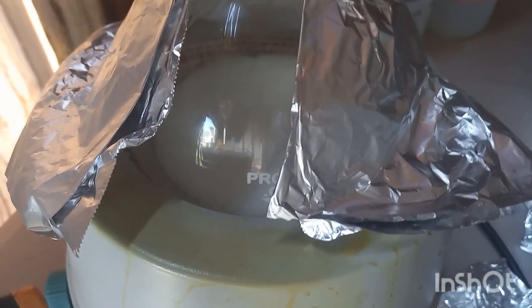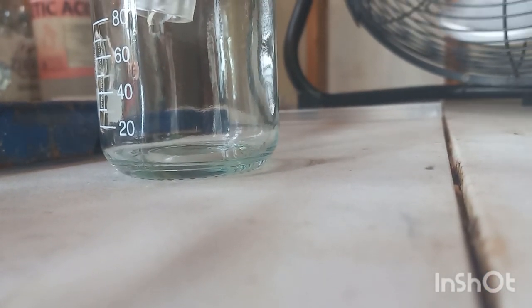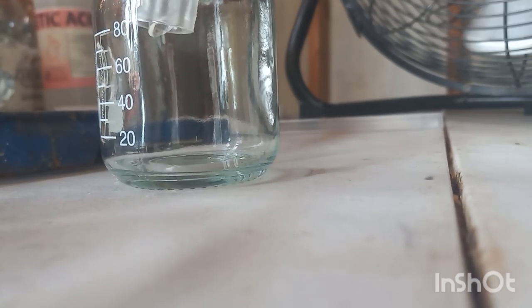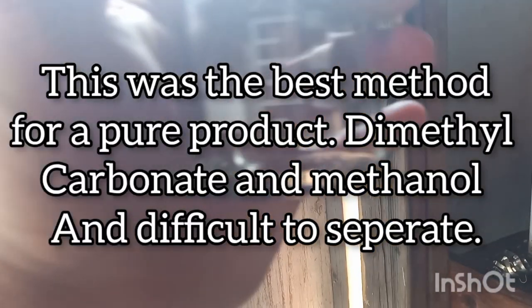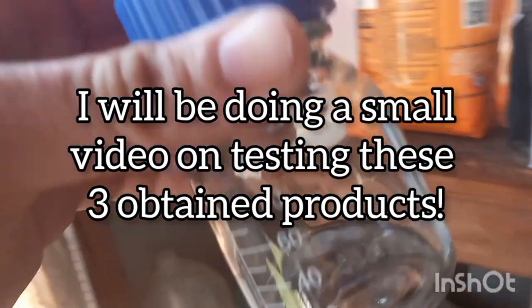We have a thick, milky, boiling flask. And then we have this. It's not coming fast, but it's pure. Alright, cool. Looks like I got about 10 mL, maybe 12 grams.